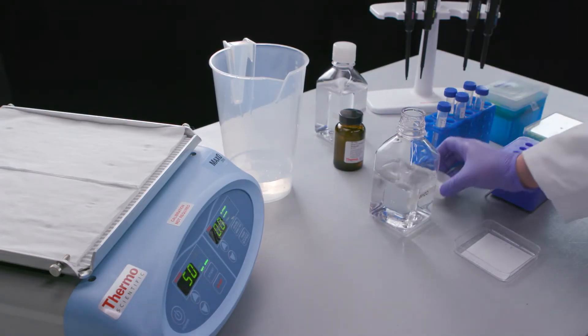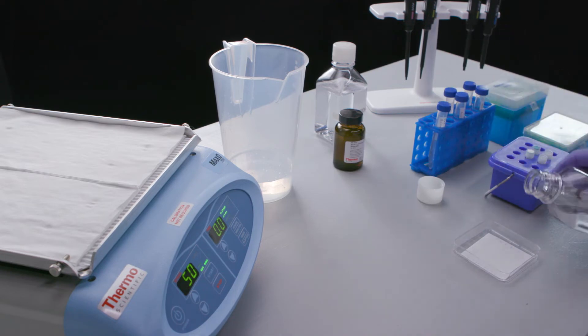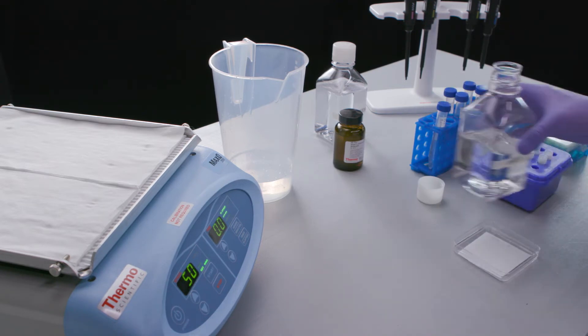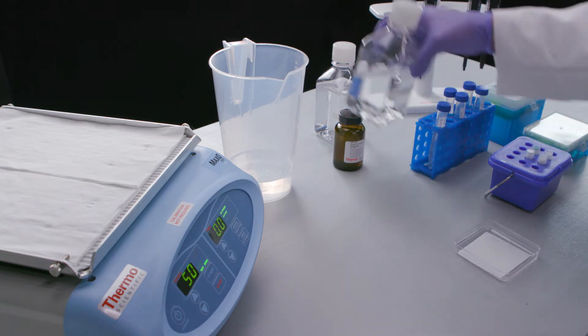In this video, you will learn how to perform a two-plex fluorescent western blot with Invitrogen Alexa Fluor Plus 680 and Alexa Fluor Plus 800.